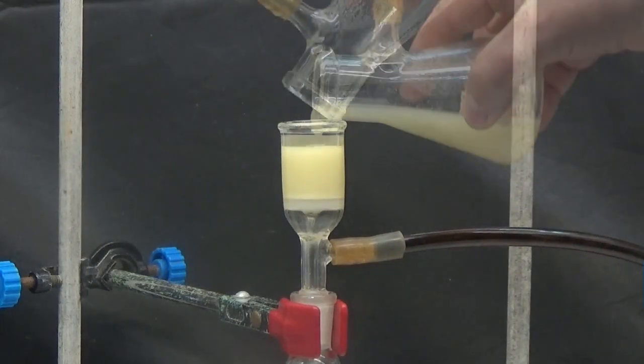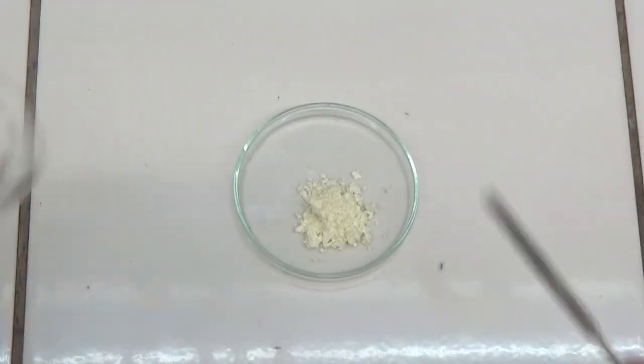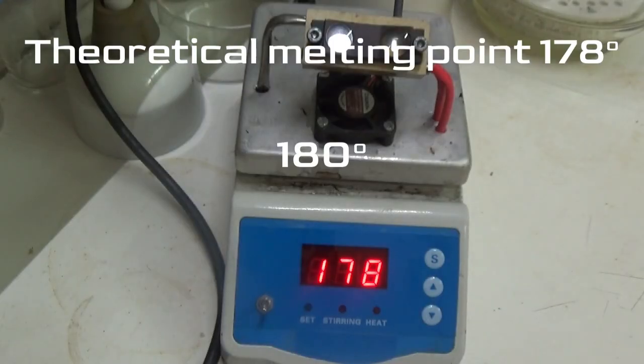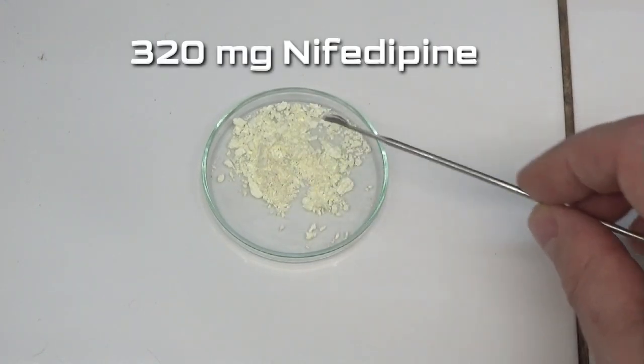Collect the nifedipine by suction and dry in an oven at 60 degrees. Once dried, we determine the melting point. The melting point of nifedipine is 178 degrees, and in our assay a value of 180 degrees was obtained, a fairly pure product. In this operation we obtained 320 milligrams of nifedipine.